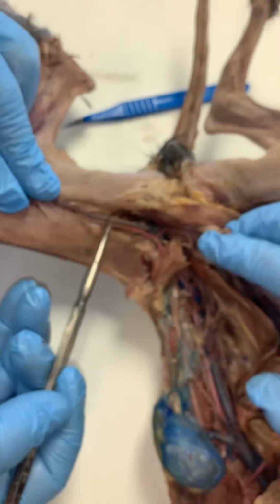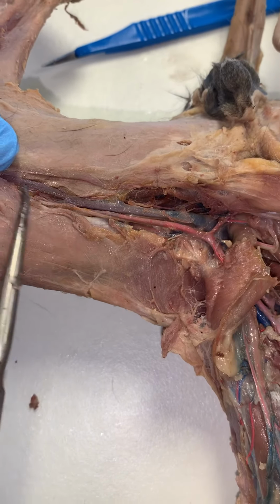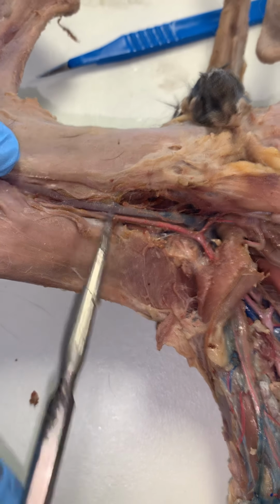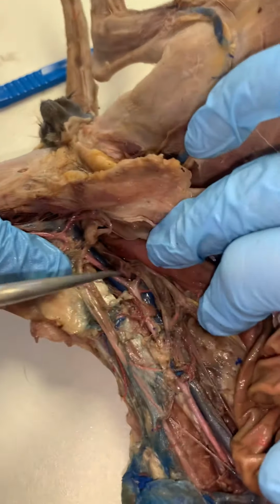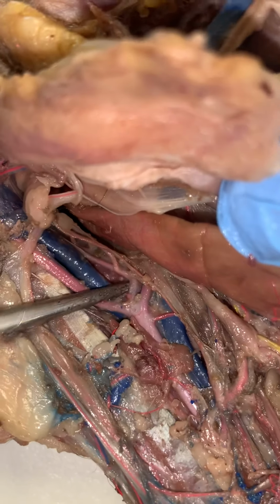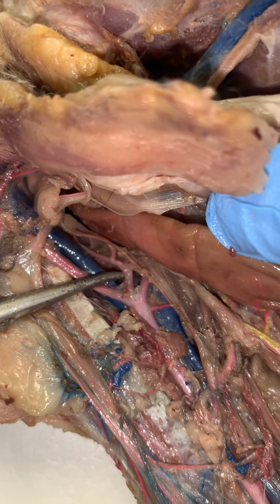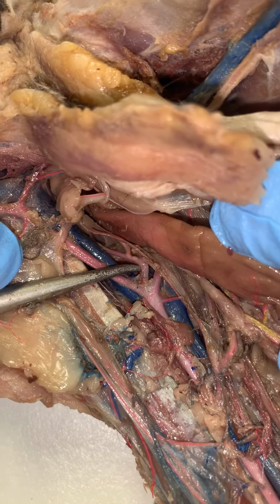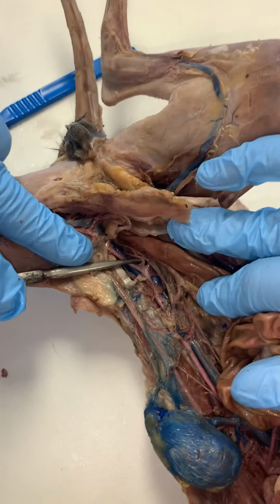Now notice too how the femoral vein is in parallel with that artery that you see right there, which is very similar to what we saw in the upper extremity with the brachial artery and the brachial vein. The other one I want you to see is ever so tiny. It's this little rascal that we can see just right here. This is the internal iliac artery, and this will be going to deep structures like the urinary bladder, the reproductive structures of the female cat, and those types of things.